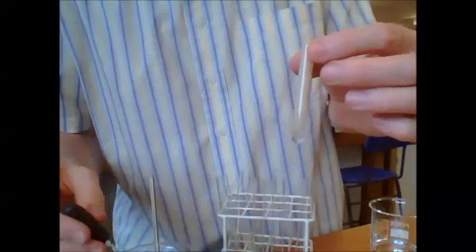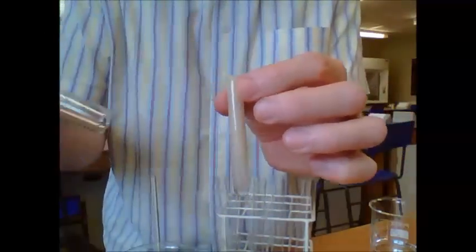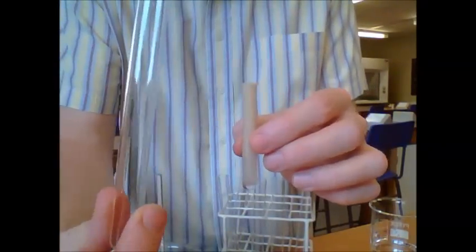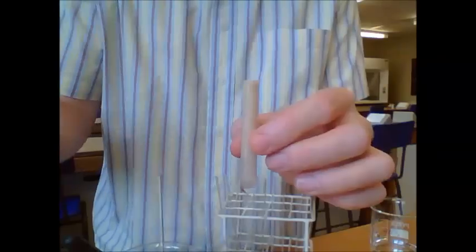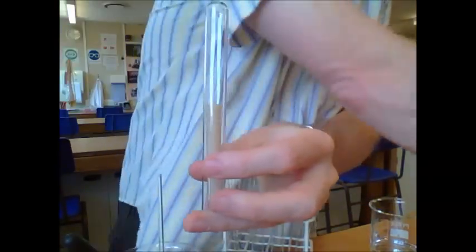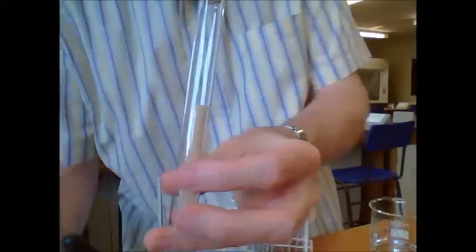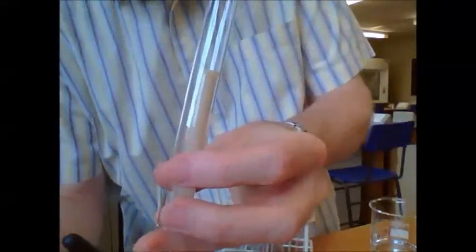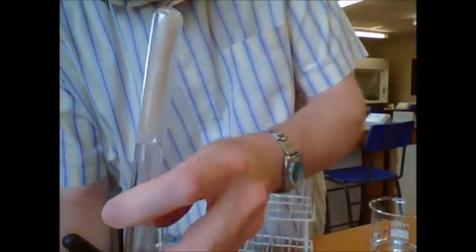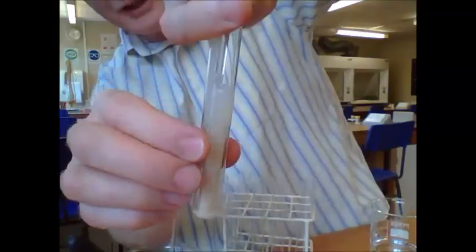You can try and make sure you mix it a little bit. Then we've got a technique now to get this inside an ordinary test tube. Pop it over the top like that, take a glass rod and poke the tube up inside. Then quickly invert it.